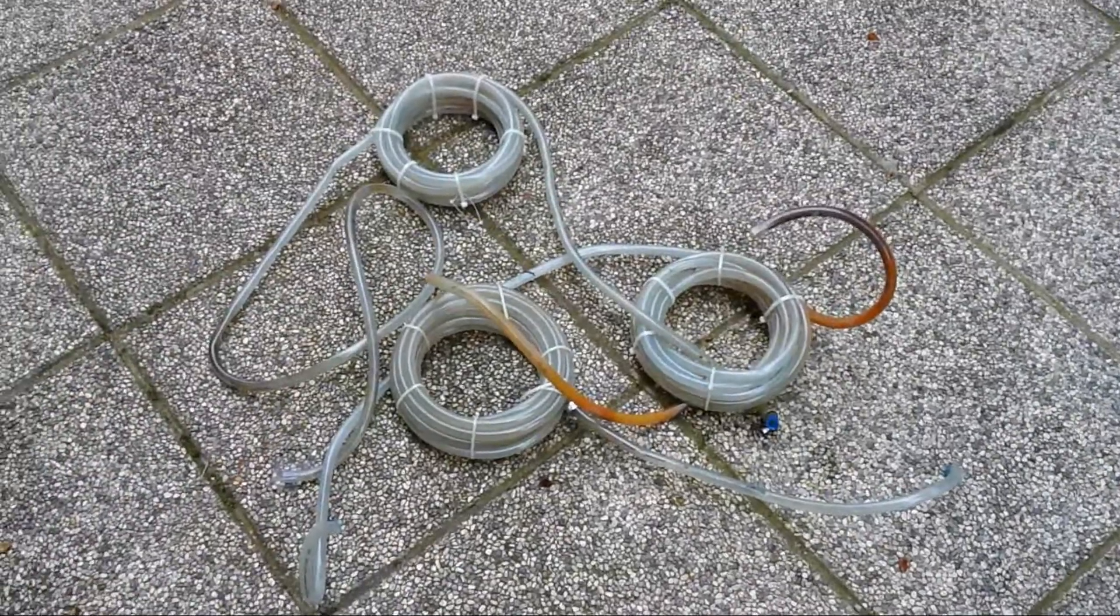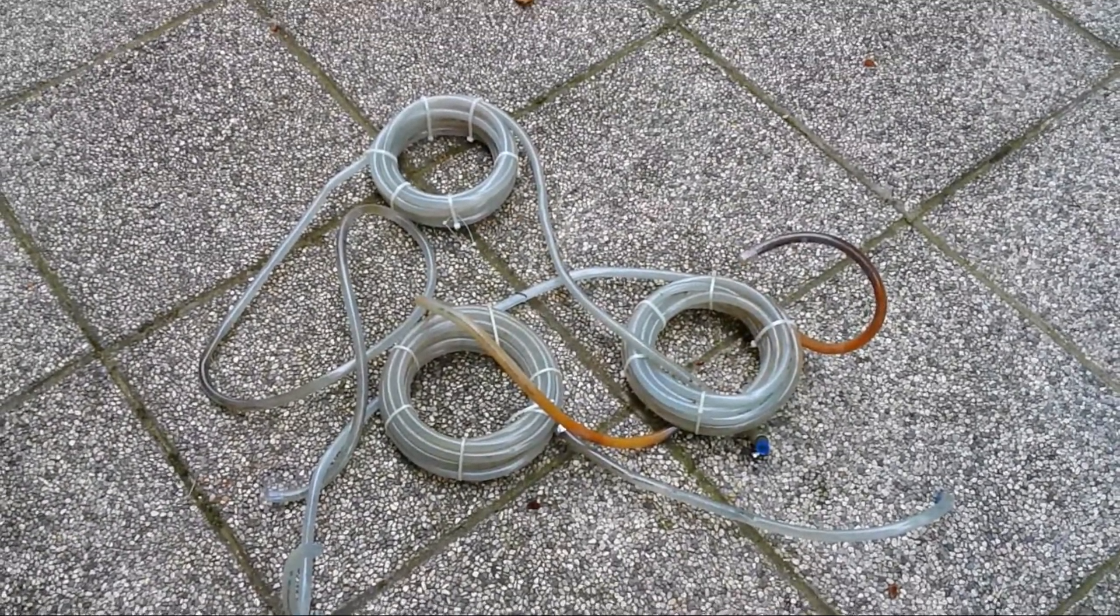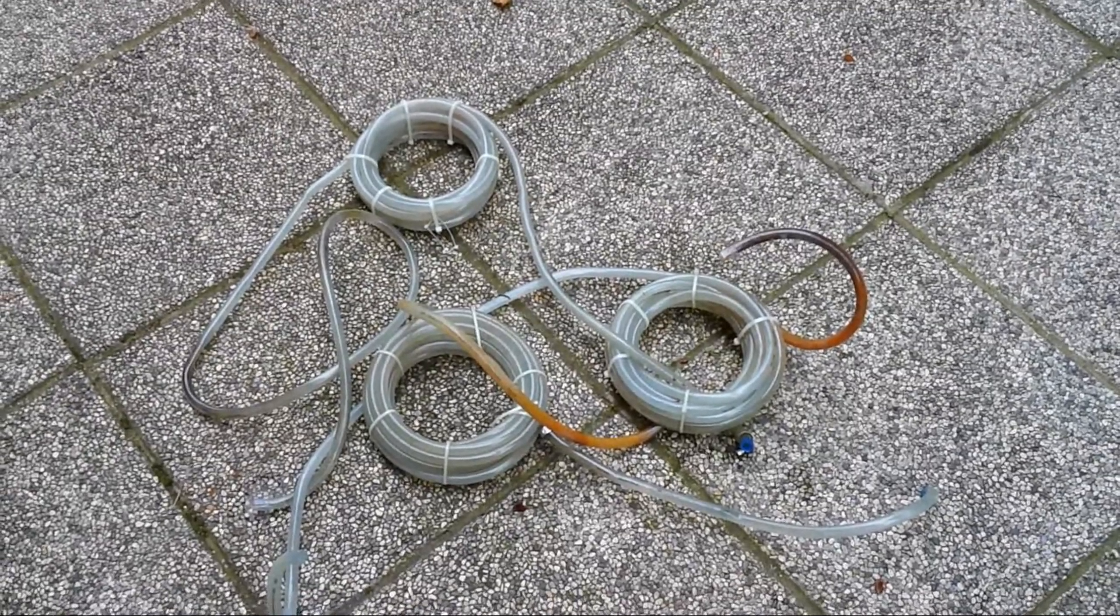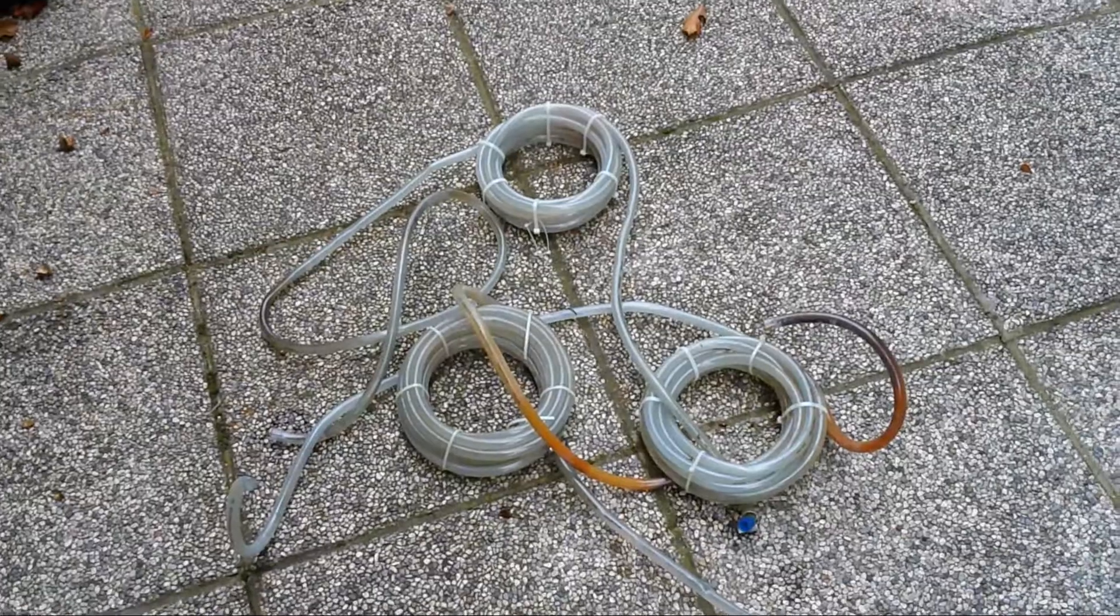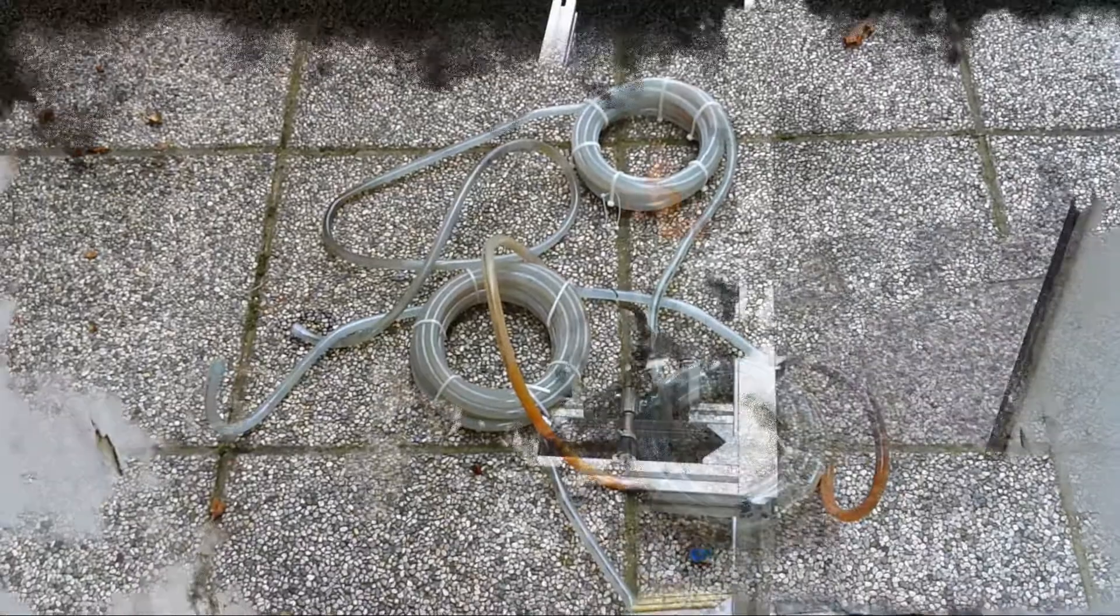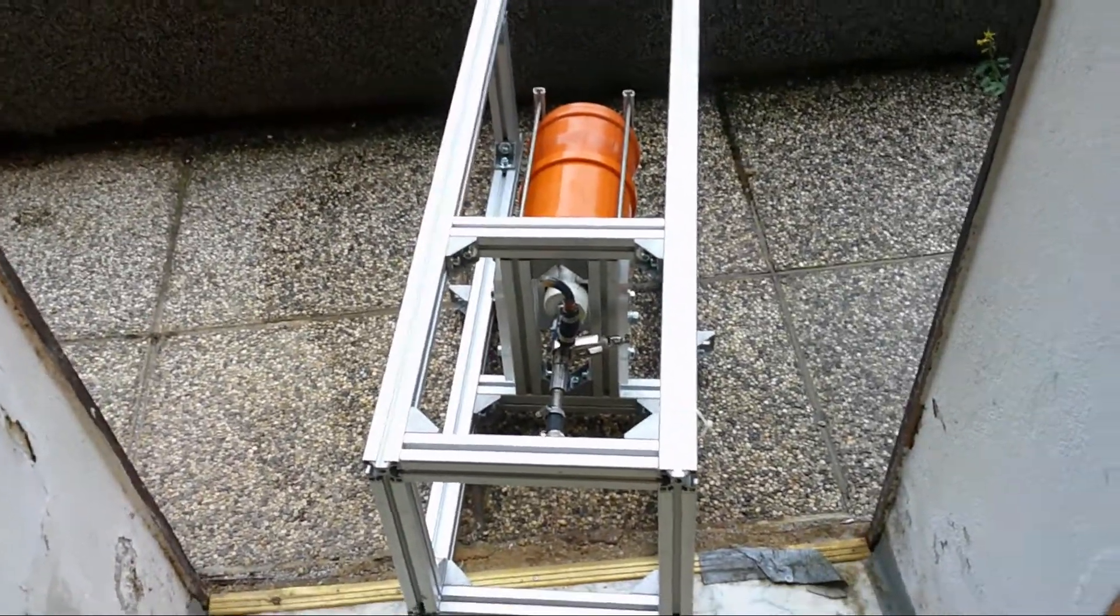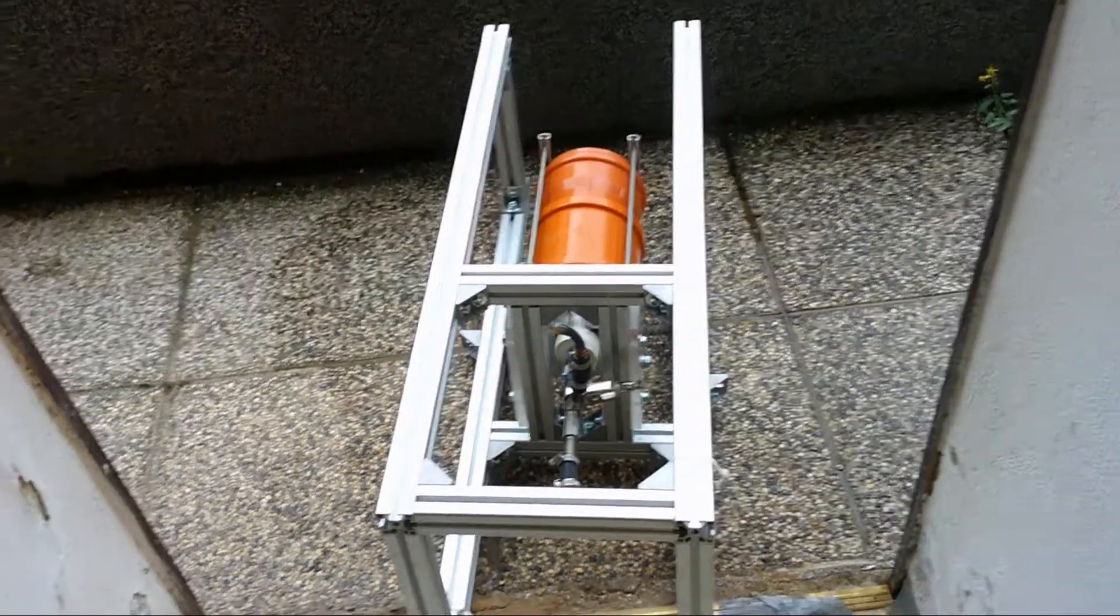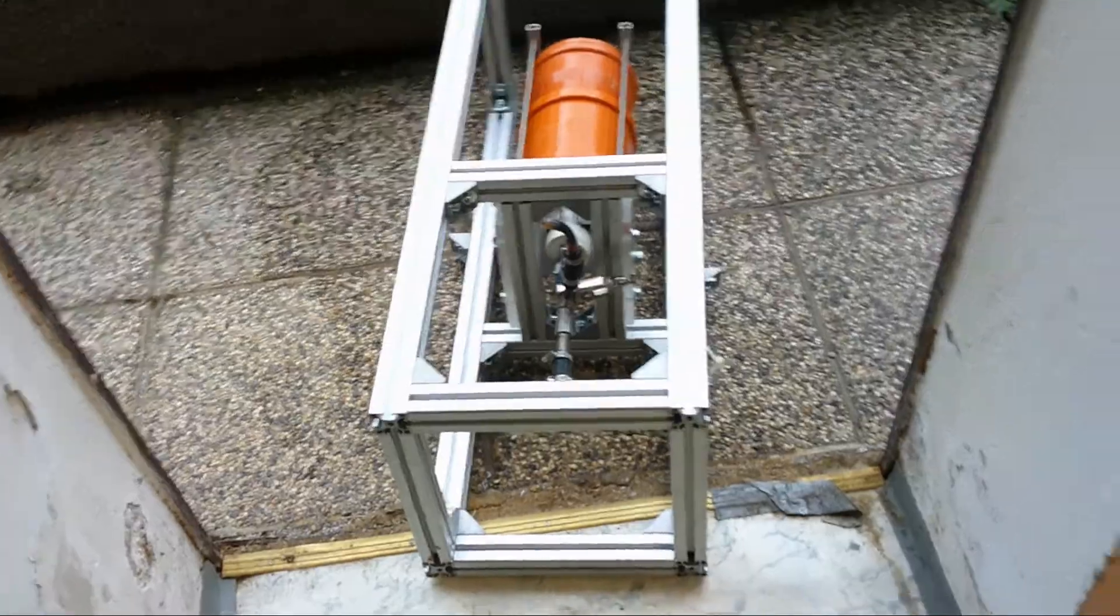As you can see I have removed all the tubings and thrown it out here because there is still a lot of water inside, and I created a mess inside. So now I let the water flow out of the tubes. Now I have put it out here to let the cooling water flow out. There was actually still quite a lot of water inside. And on the floor I created a mess.